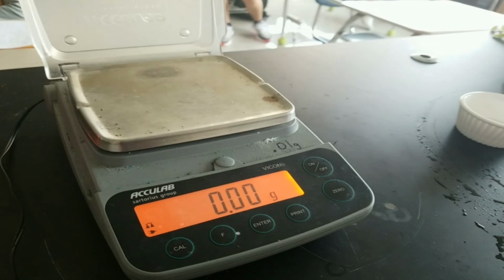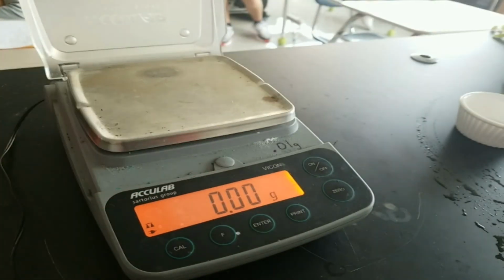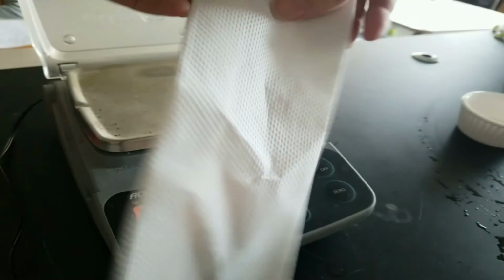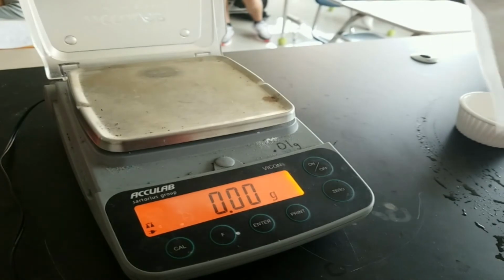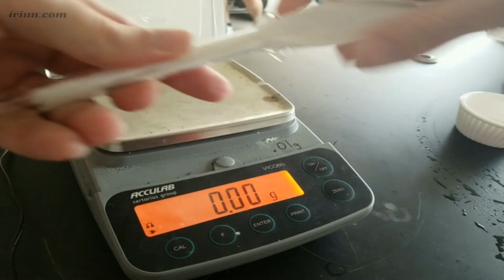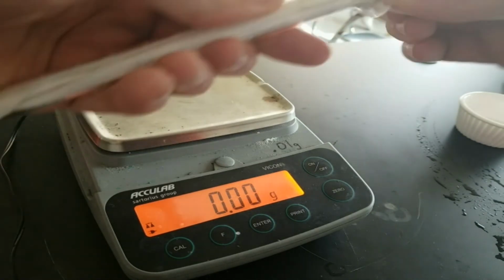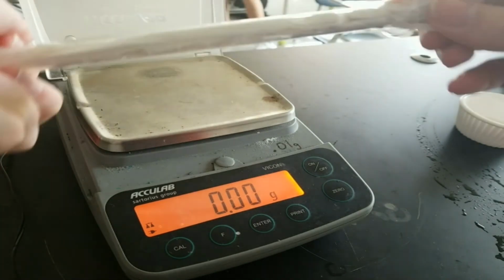Now, I have my cylinder here, and as you can see, there are droplets of water in it. To reduce error, I'm going to take a paper towel, rip it in half, long ways, crunch it up, and clean out my cylinder. This way, I reduce my error. See if you can get it all the way down there. If you cannot get it all the way down there, then that is an error statement. Look, I did get it all the way down there.